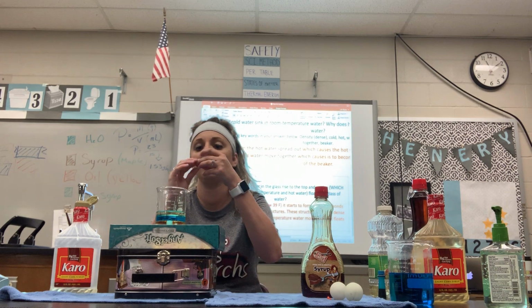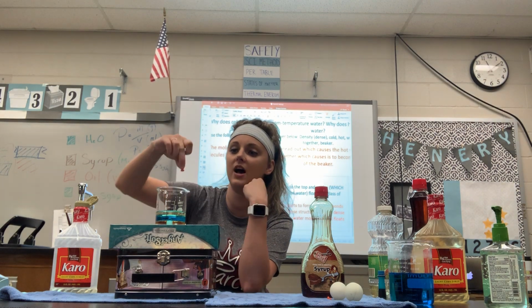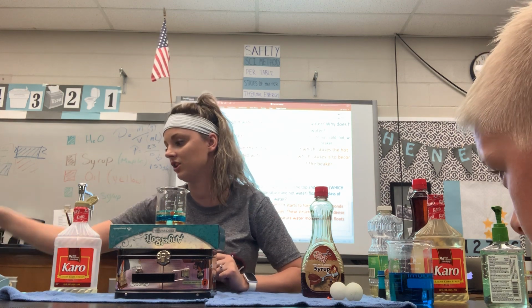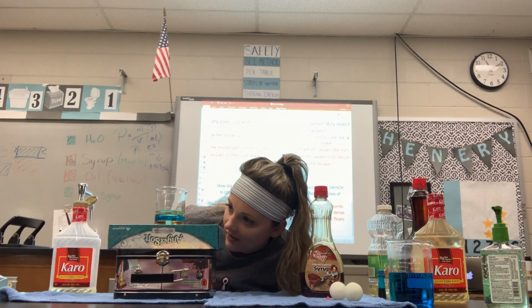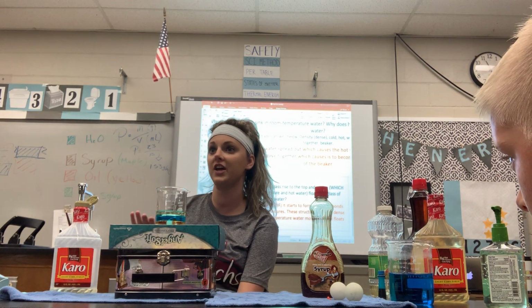This is just a bead. Now the bead actually has a little bit of an air pocket here, so at first, if I put it upwards, it may float, and as you can see at the top, it actually hasn't broken the surface yet, so the water hasn't entered into the bead, therefore it's floating. Once it gets in there, it will actually sink. See how it's starting to sink? Stuck on the marble. Yep, but where does it stop? Right at the edge of the water, starting at the syrup, okay?